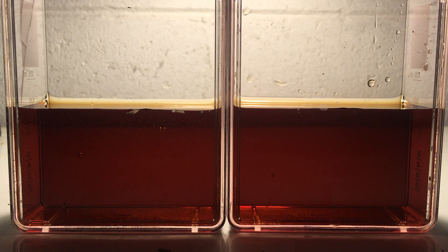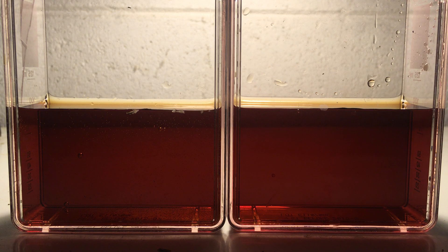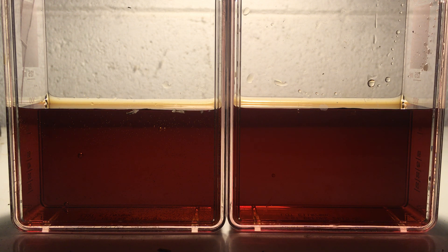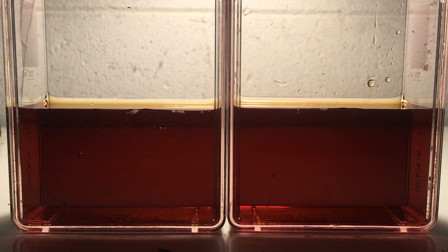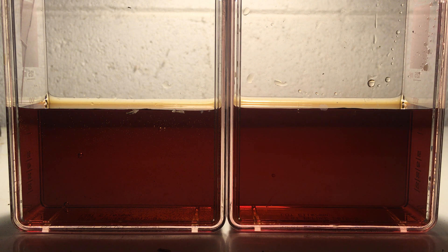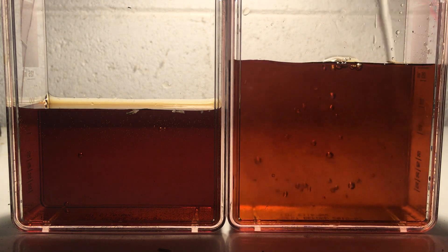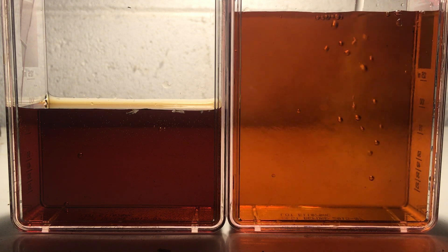They have the same path length and the same concentration. Now what I'm going to do with the container on the right is dilute that solution by a factor of two — going from 100 milliliters to 200 milliliters.